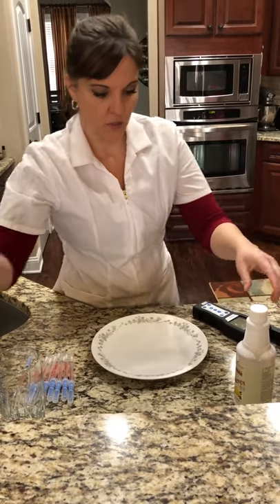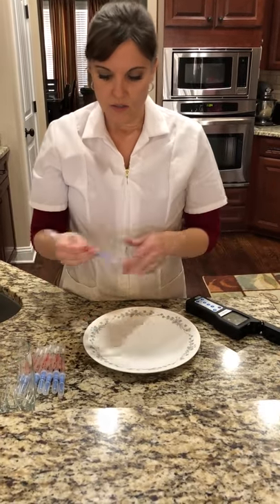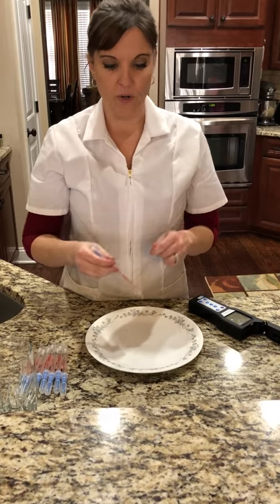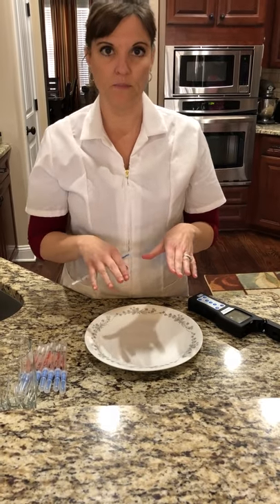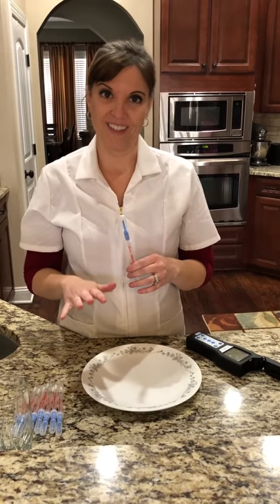All right, so we're going to test the plate first, and then we're going to contaminate with raw chicken. We'll clean that off, wipe it down, and swab it, so we'll know what the reading is starting out with raw chicken before we clean it.